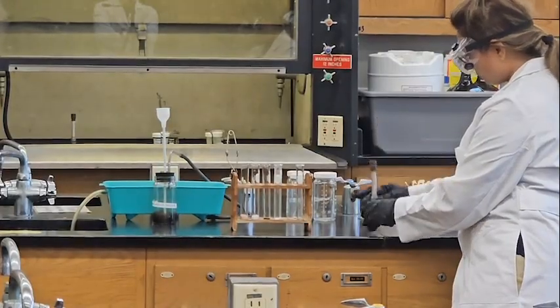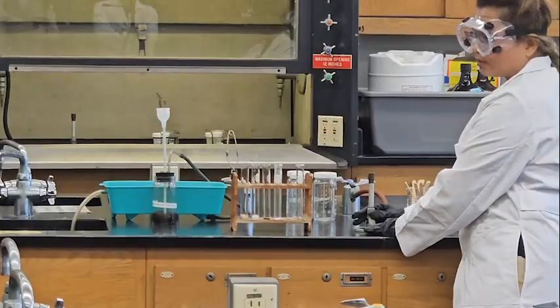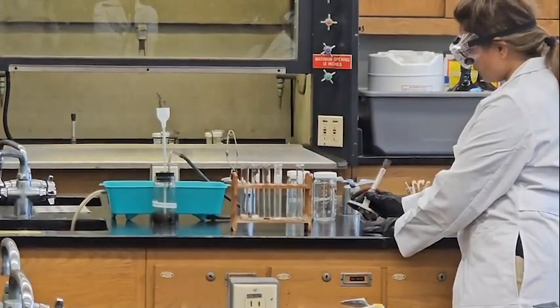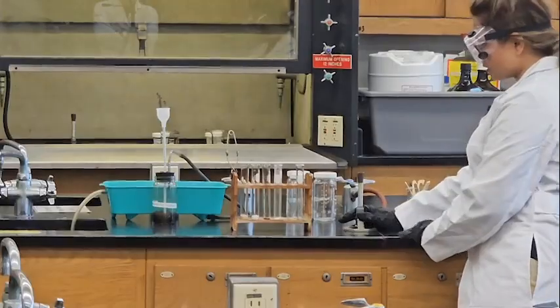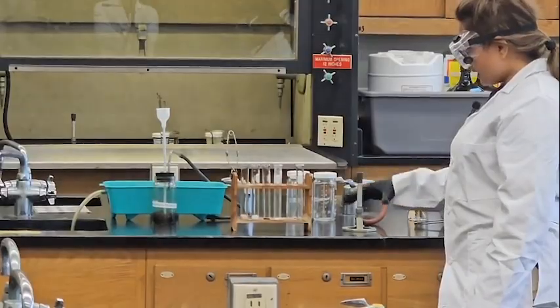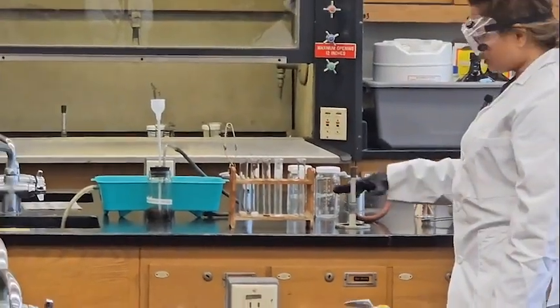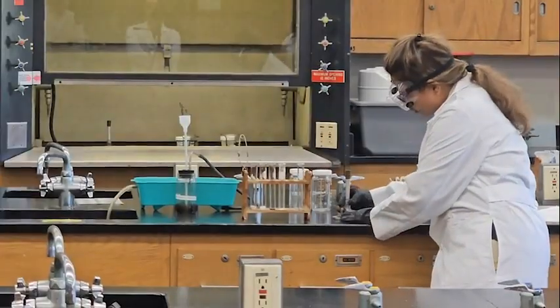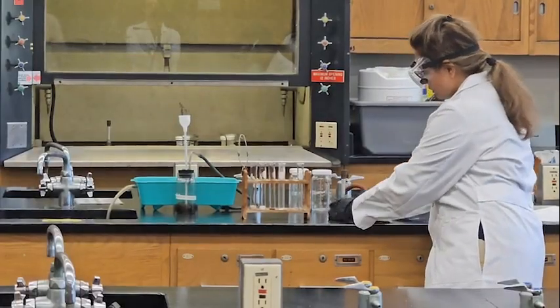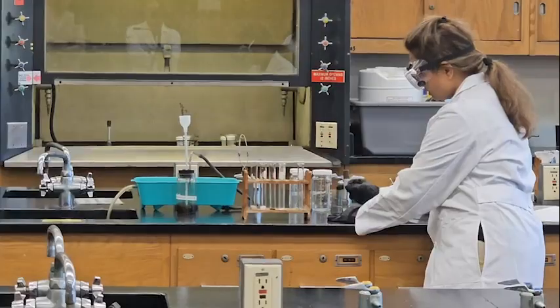It's already closed. When you handle the Bunsen burner, make sure someone always stays very careful, because it may fall down and cause a fire. Someone should be in attendance to manage the Bunsen burner. This part you can hold, it is not going to be hot. The bottom part you can handle, but never touch this upper part, because it will be heated up.